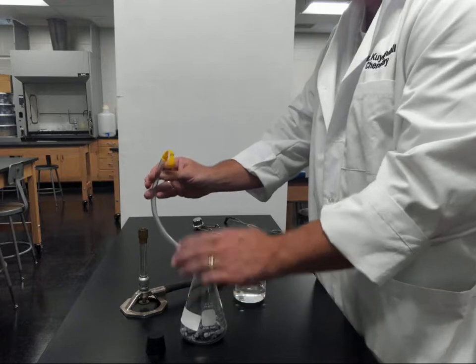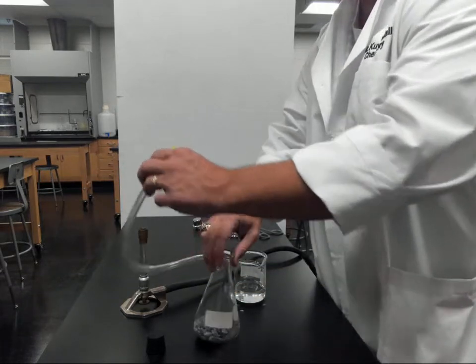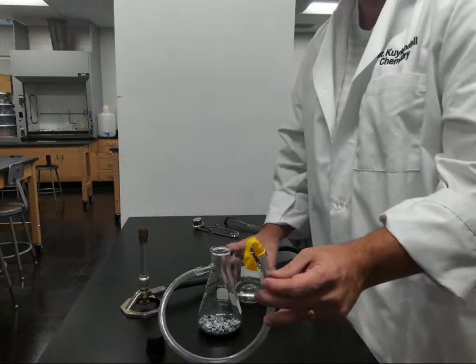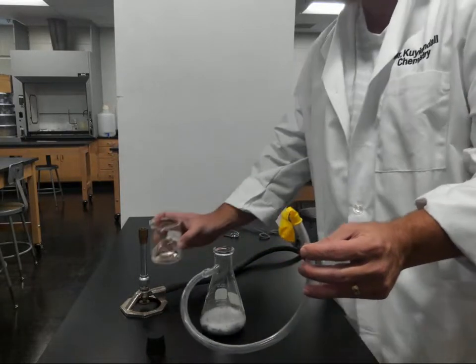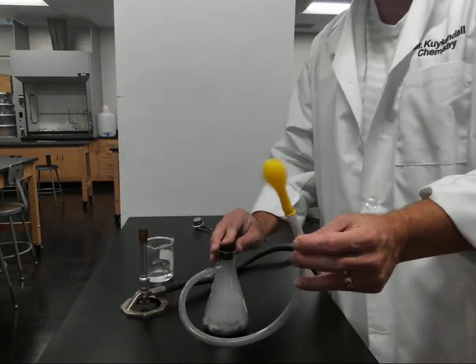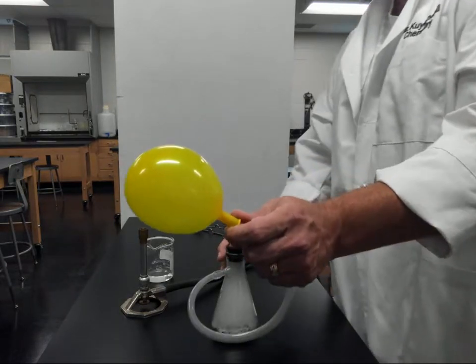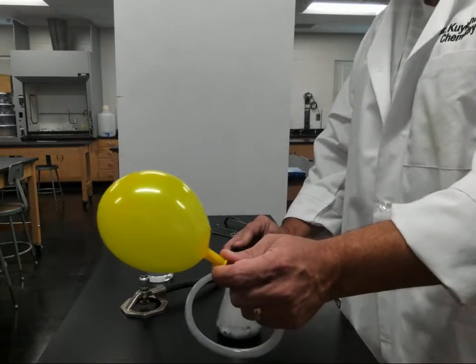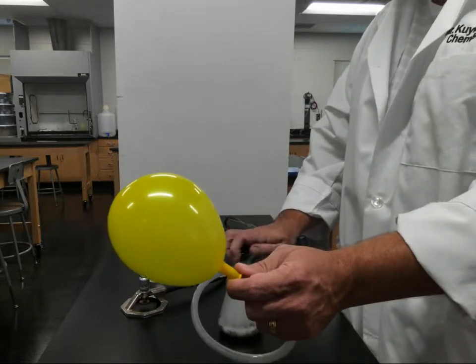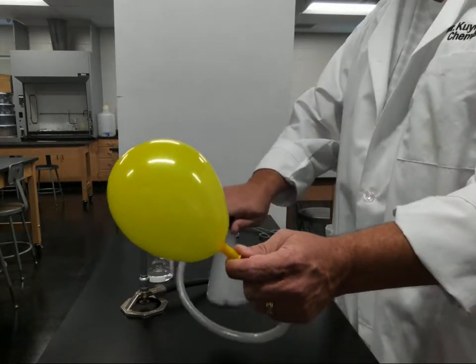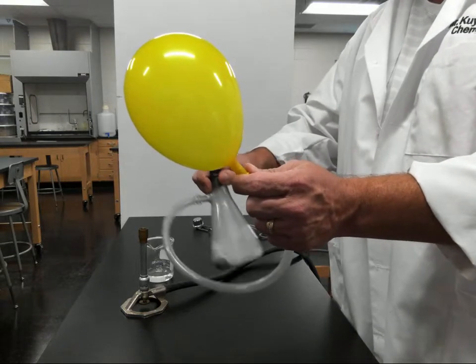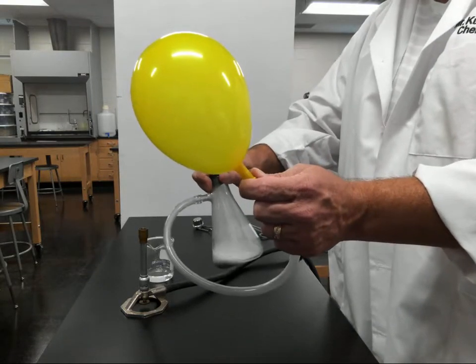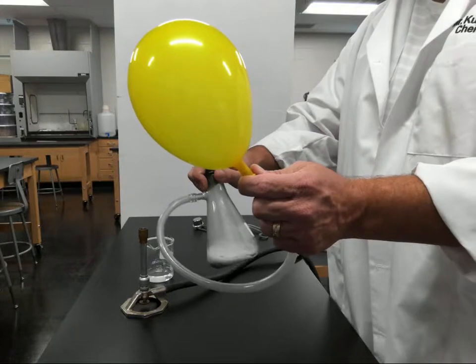As you can see, the hydrogen balloon is inflating relatively quickly. This reaction happens to be an exothermic reaction. It generates a considerable amount of heat. If you were to actually feel the bottom of this flask, it would be rather warm.